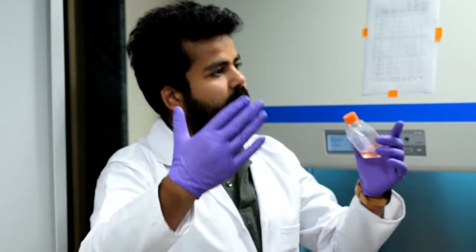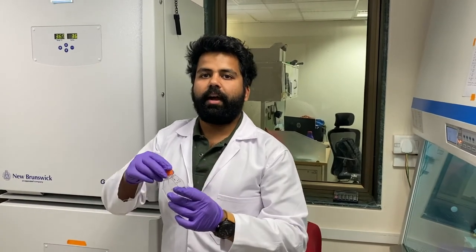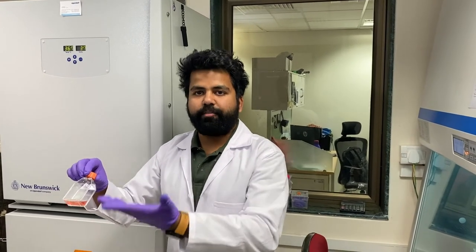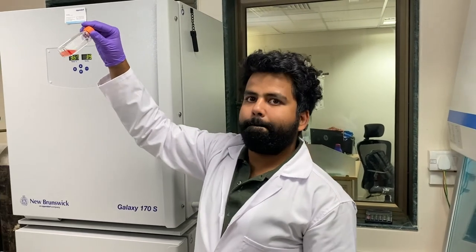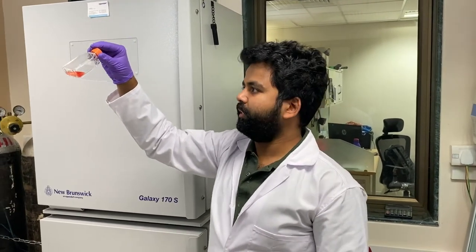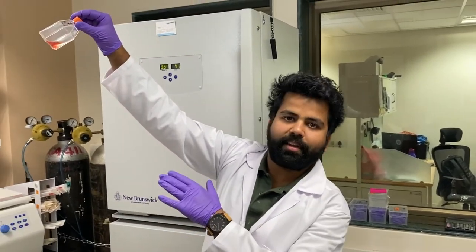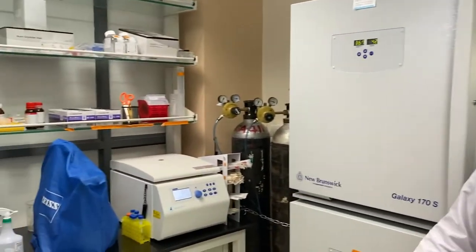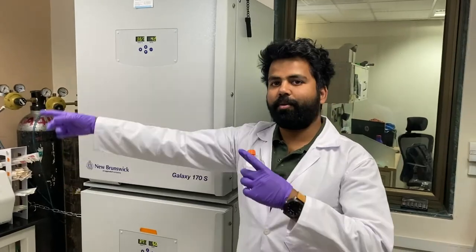To split cells, we take them off the substrate, collect them, and add them to a fresh flask where they can flourish. This way we maintain cells in culture and use them for experiments. With the naked eye you can see a cloudy appearance, but if you want to see the cells properly, we use a microscope.